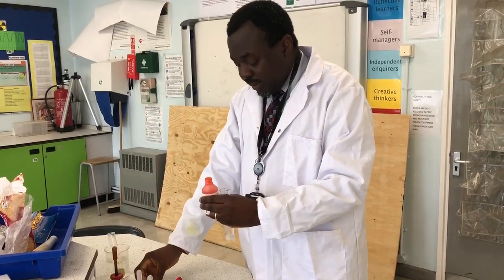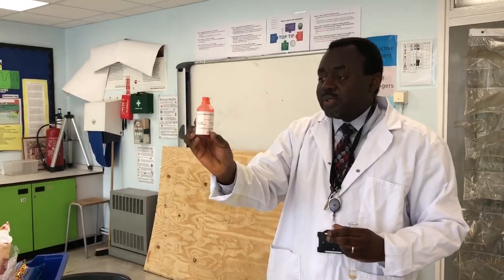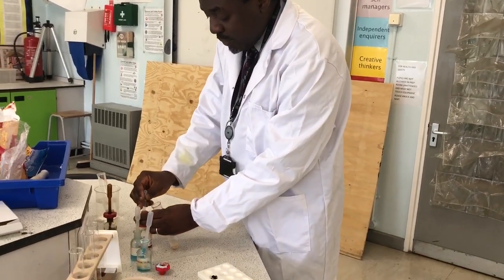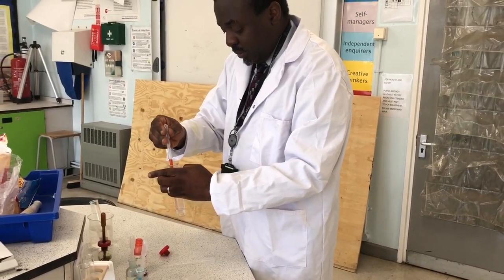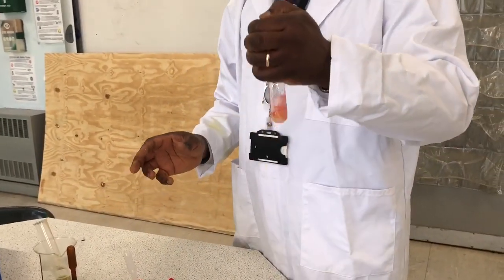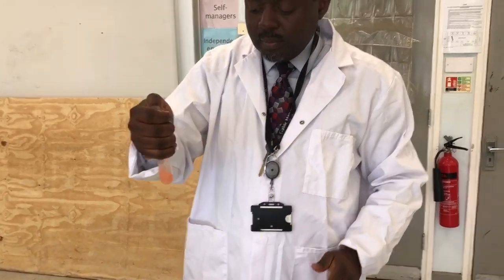And then you add some Sudan 3. So you use Sudan 3 solution for this test, and you add your Sudan 3 to that sample. And then you shake it to mix together.